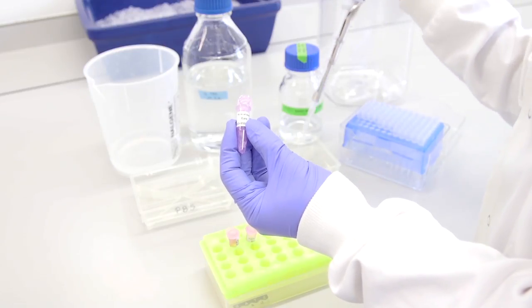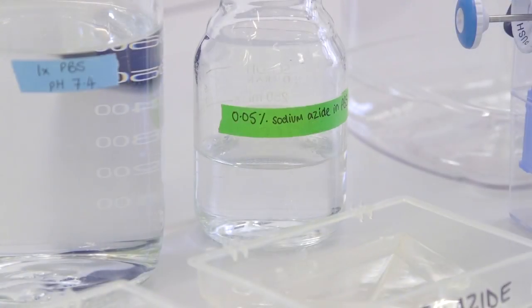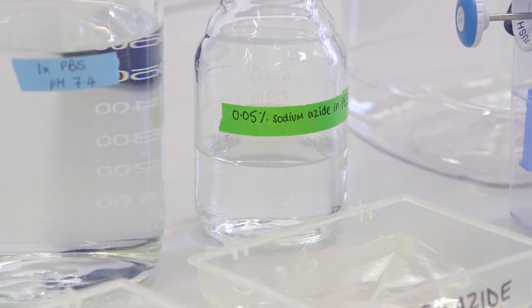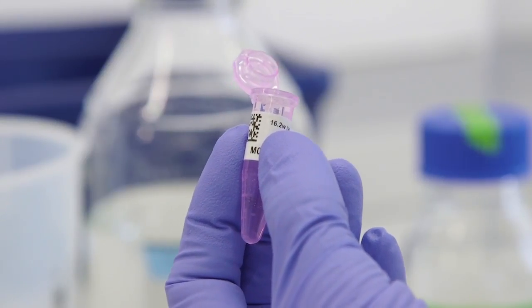Finally, add 1.7ml PBS at pH 7.4 containing 0.05% sodium azide to each tube, ensuring all sheets are covered and none are stuck to the lid.